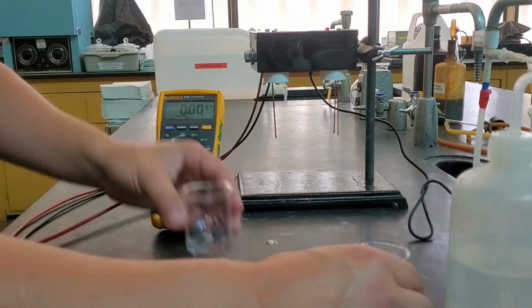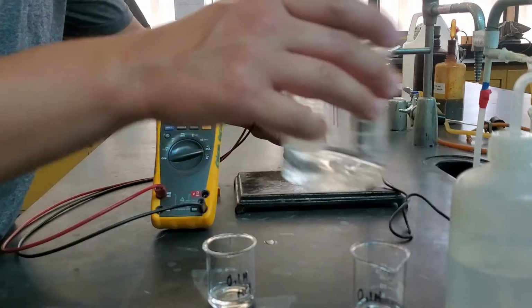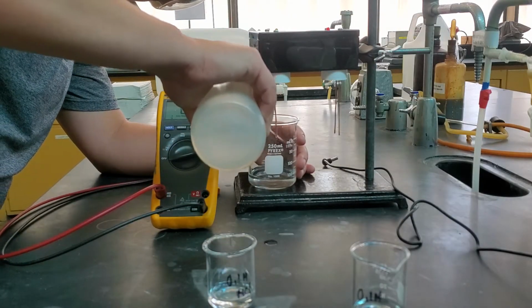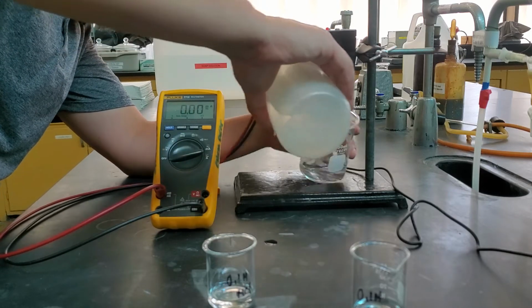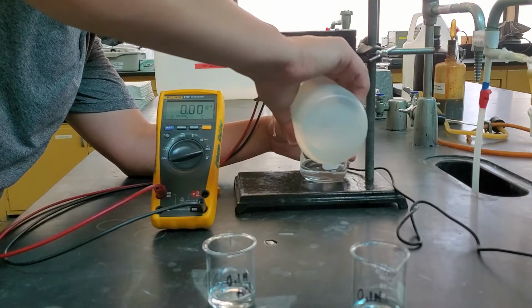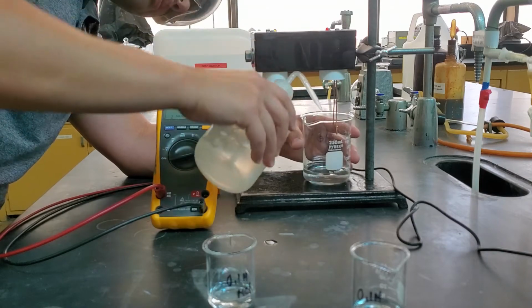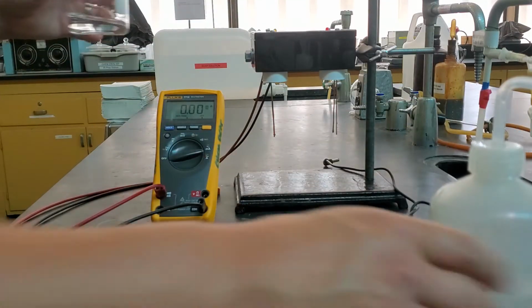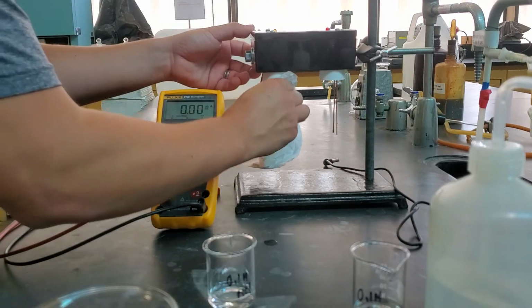I'm going to go ahead and take those off, unplug, wash just like usual. And so this is the first line, that first measurement, where we measured the 2 beakers separately, and then we're going to measure them as a mixture together.